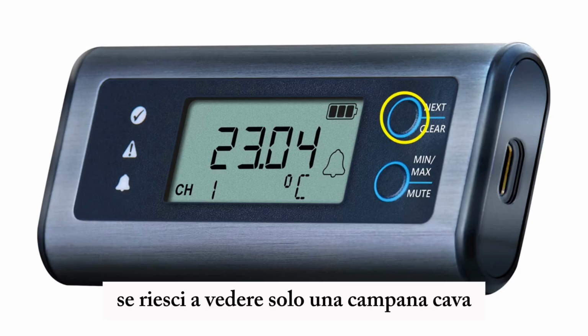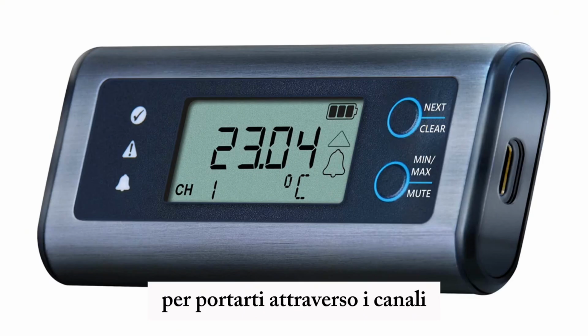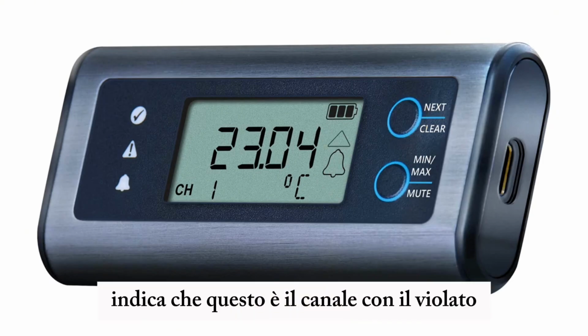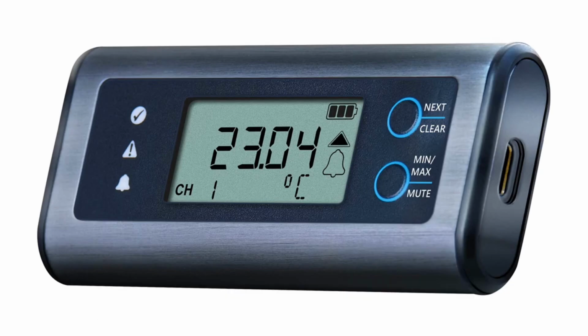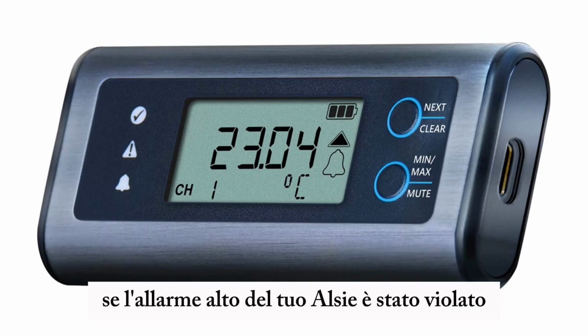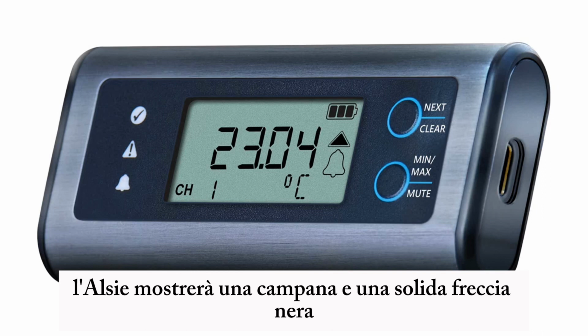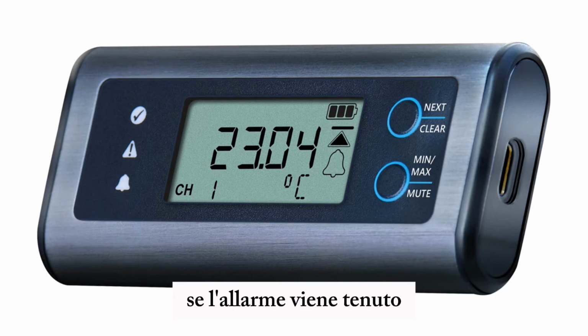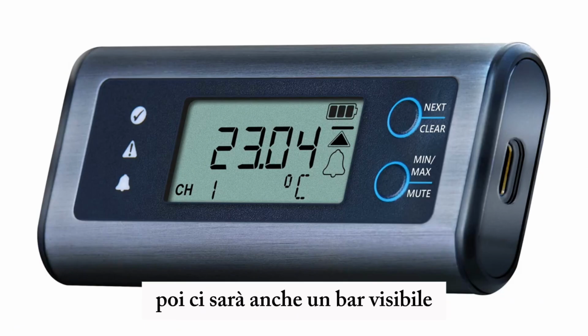If you can only see a hollow bell, you have to press the top button to take you through the channels until you find the bell and the arrow. The arrow indicates that this is the channel with the breached alarm. If your EL-SIE's high alarm has been breached, the EL-SIE will show a bell and a solid black arrow. If the alarm is being held, then there will also be a bar visible as well.